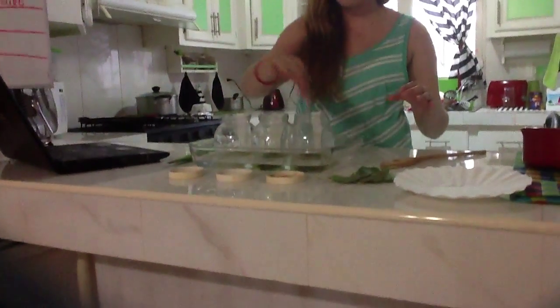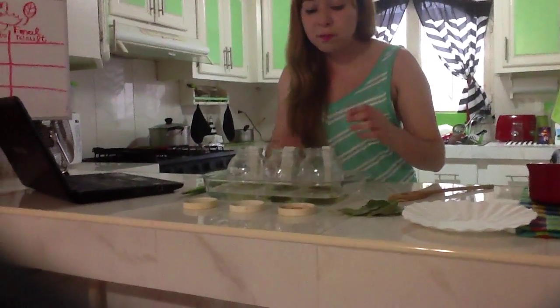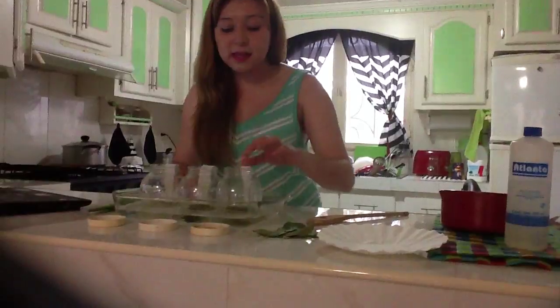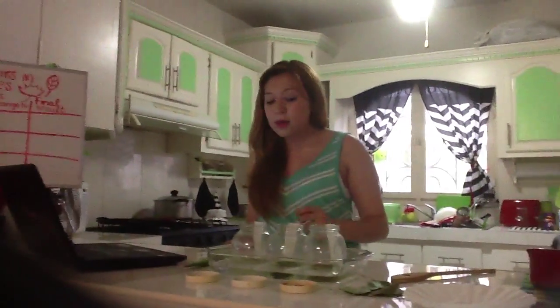As you can see, it's green inside. It's absorbing the green pigment. And we're going to place some coffee filter strips in each of the jars. The filter will extract the pigment, and you can see the difference. We're going to have the green pigment on the bottom, and on the top, the yellow, red, or any other color that the leaves change into.